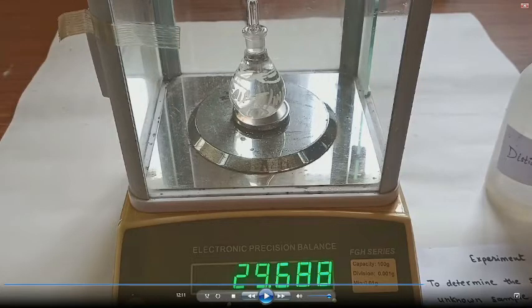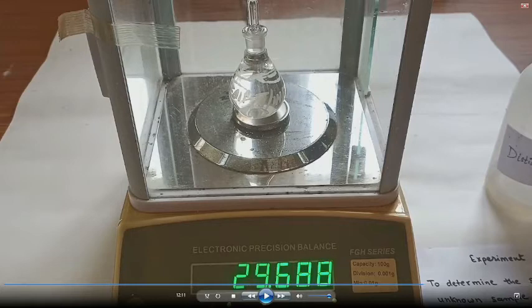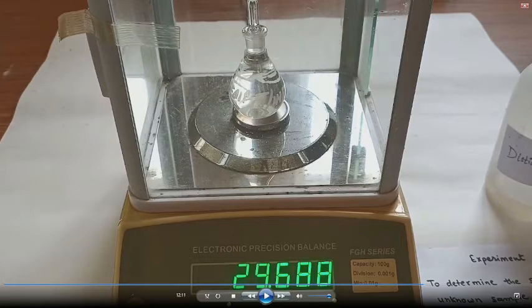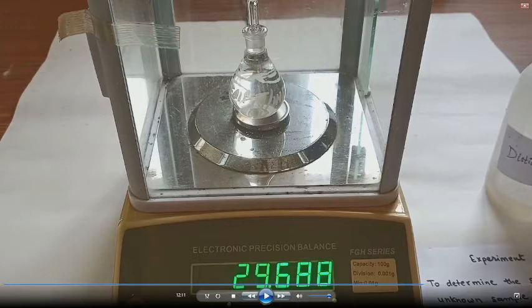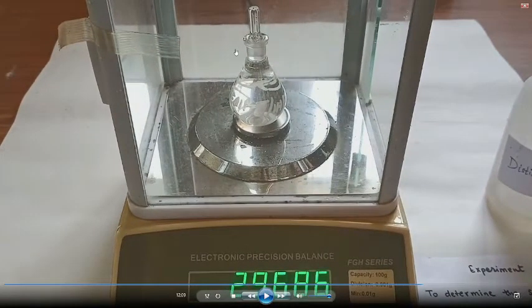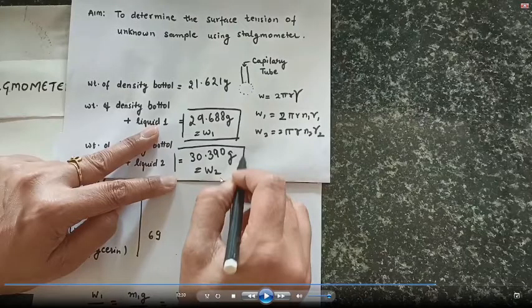One important note for students: some density bottles have a mark on them — you fill up to that mark and read the lower meniscus. If no mark is given, the bottle has a small capillary at the top, so you fill it completely and don't worry about the liquid level. There are two types of density bottles, so know which type you have. You can see this hole here — this is the small capillary.